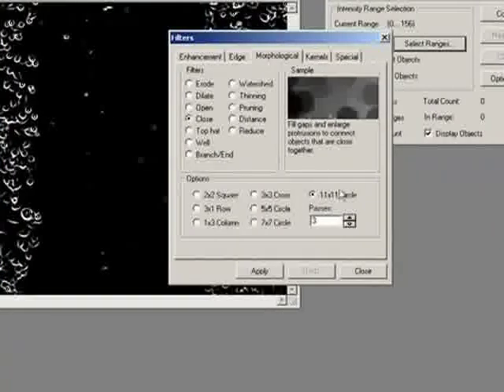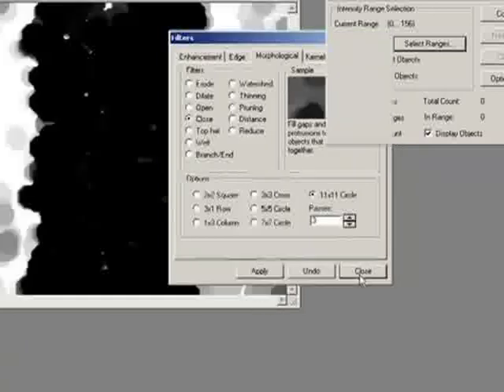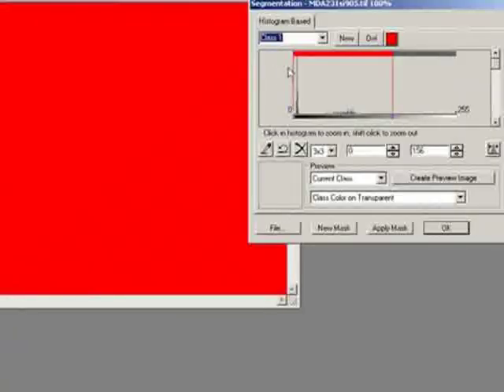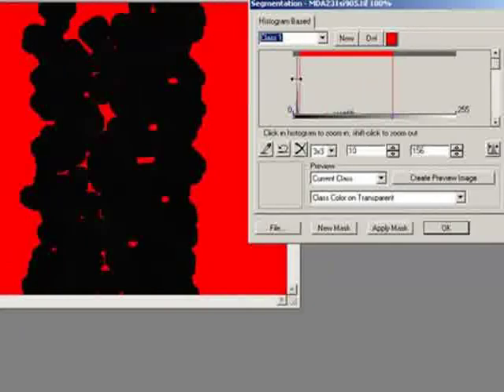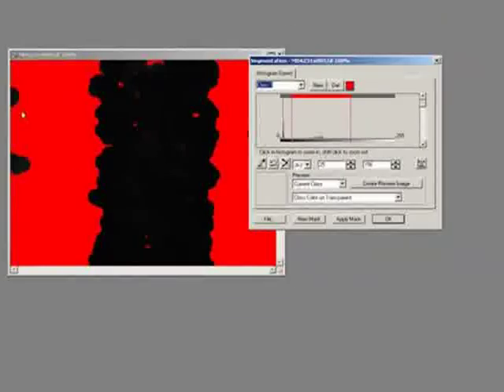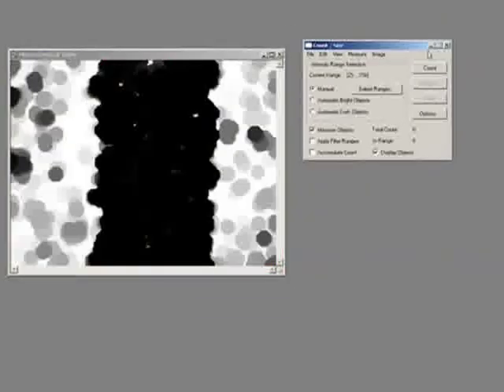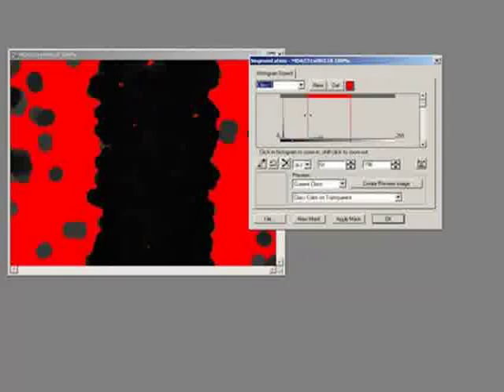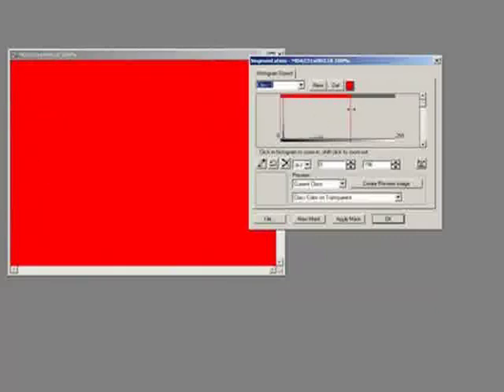And you can see a close with an 11 by 11 circle is a nice big close filter that's really going to join everything together as a solid object. Now, what I'm going to try and do is threshold. Now, you can see here I've got my objects. I have the center, and what I could do is try and just segment like that, but I've still got these two little holes here. So I'm actually going to reverse segment. I'm going to segment the middle out.